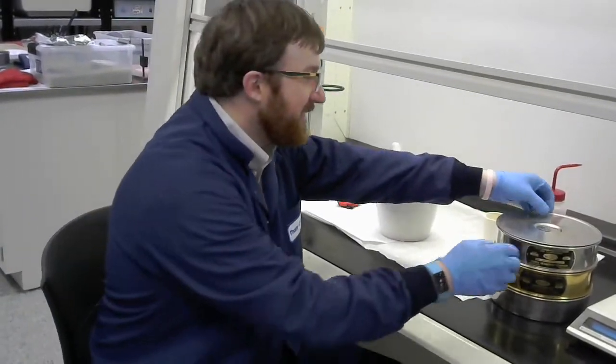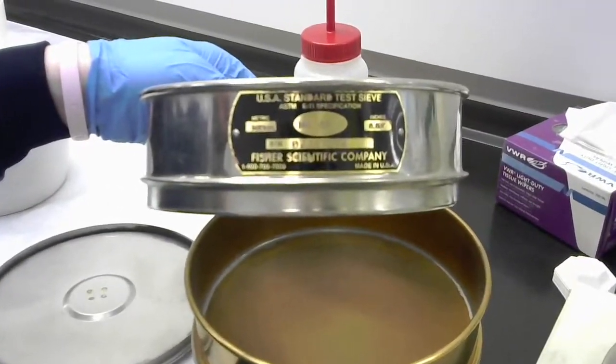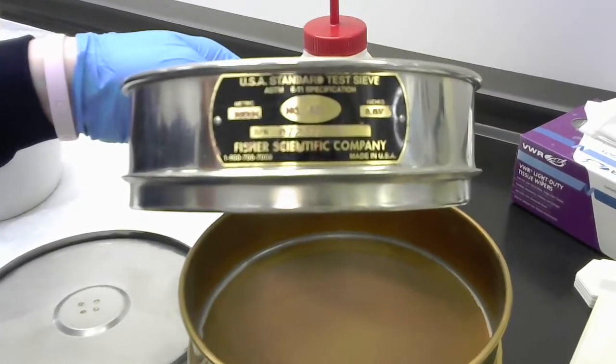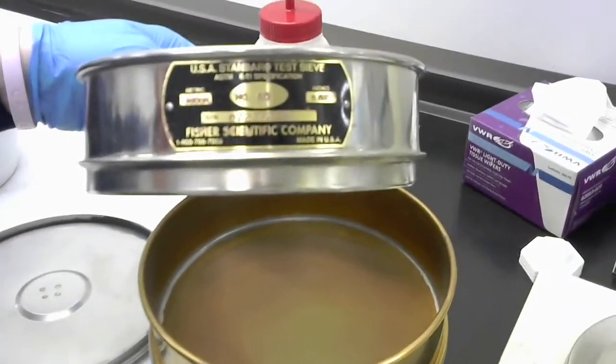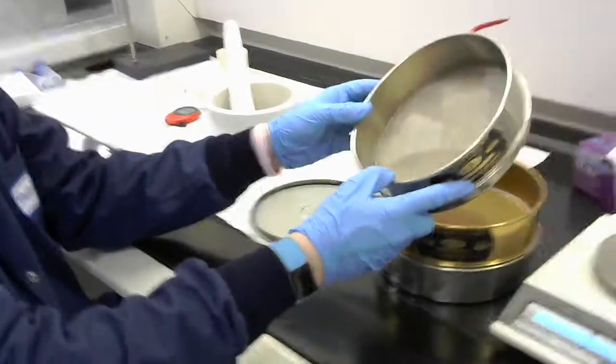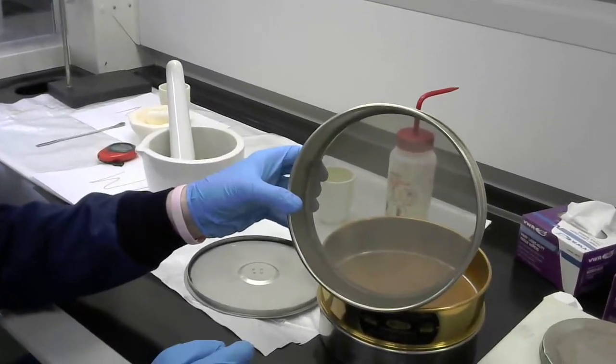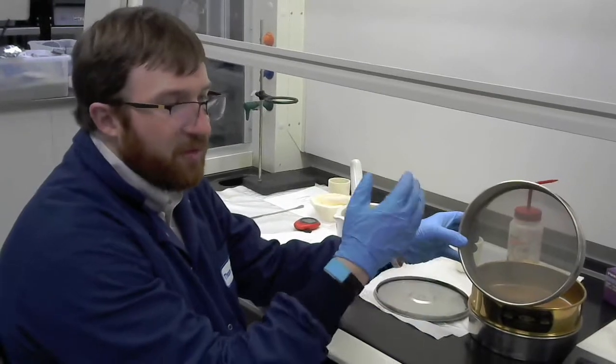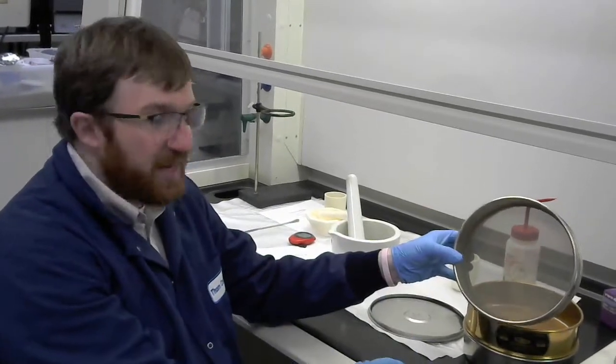And I've got my sieves or sieves over here. So basically what these are, and I'm going to open up the top here and show you the first one. So you can kind of note the supplier is not super important here, but there is a standard for these sieves. And the most important number there is the number. So it says number, and then you should be able to read that as 80. You might be able to read the opening size, but you can also look these up. So these are something that you can look up in tables. So if you can kind of see the openings here, and I'll kind of move it around a little bit. This is basically like a colander or something that you would have in the kitchen. So these are just wires that run in a cross pattern. And so they have square openings. And so that's all this is. It's just very fine openings.